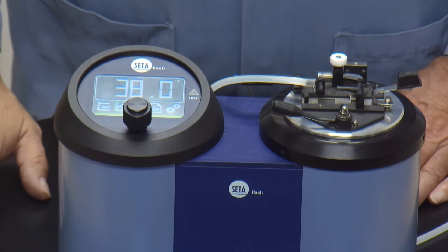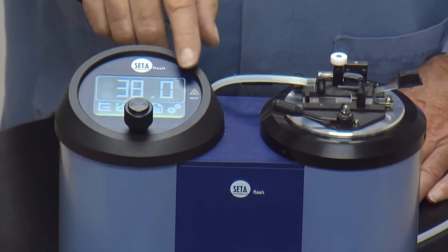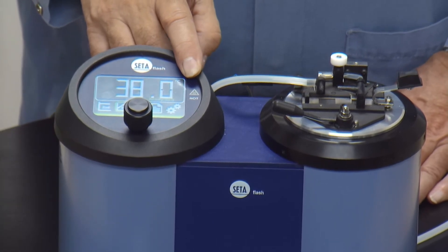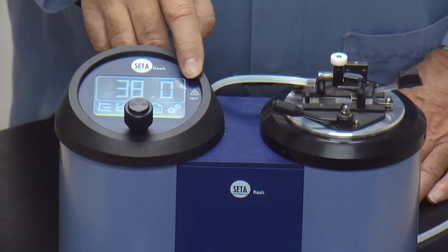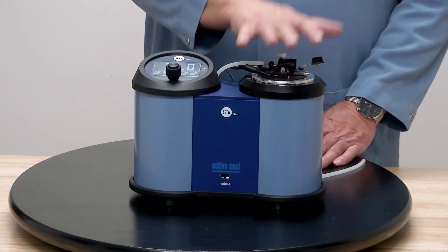The only other thing on the control side is the hot icon. When you get above 60 degrees C, this light comes on letting you know that on the cup side, that surface is hot — be careful, you could burn yourself.